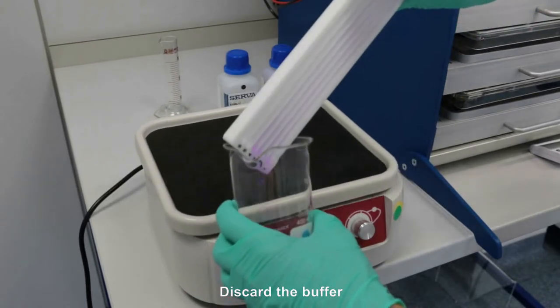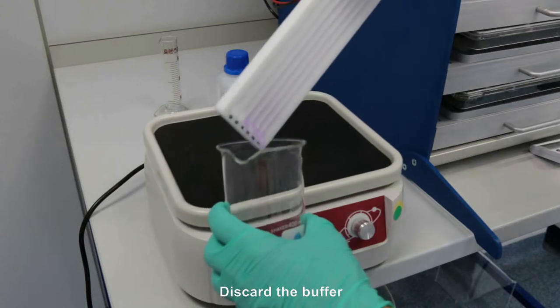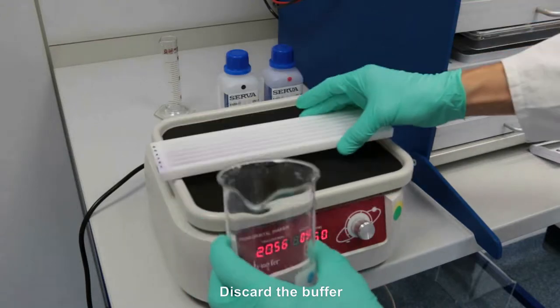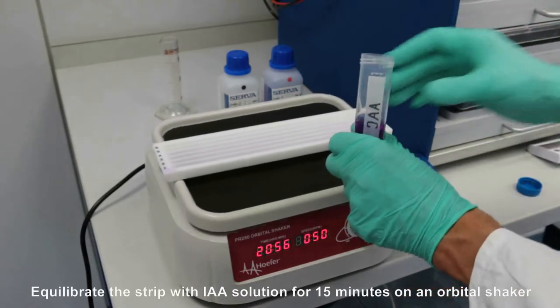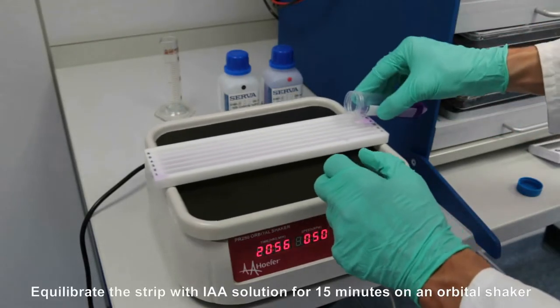Discard the buffer and equilibrate the strip with IAA solution for 15 minutes on an orbital shaker.